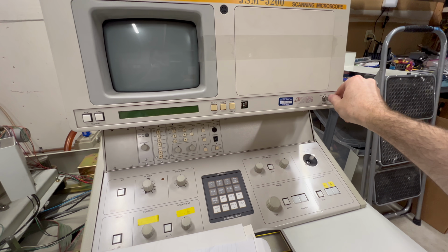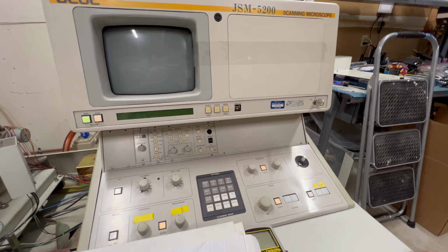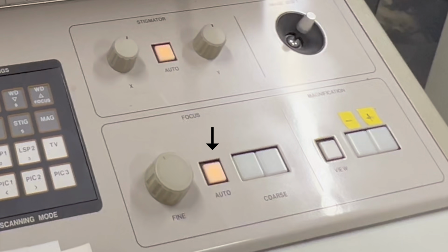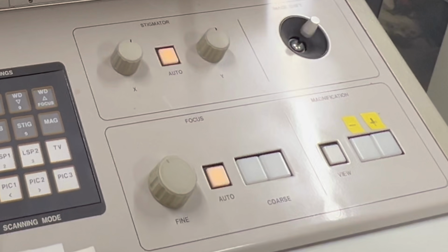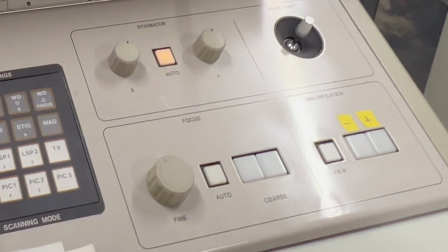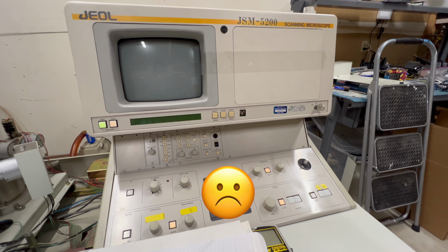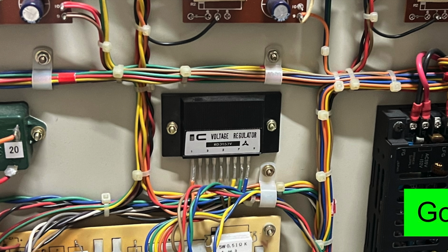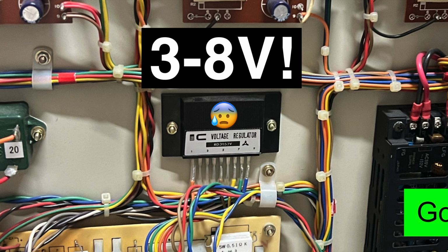Let's see if we can turn the machine on now. Okay, that's not right. What in the world is going on here? Well, as far as I can tell, all of the digital logic is going completely haywire. That is not a good sign. I checked the schematics and found that the digital logic is fed by 2 different 5 volt power supplies. These power supplies are these ancient 5 volt linear regulators with massive heat sinks. I tested them and found their output voltage was wildly erratic, so they need to be replaced.